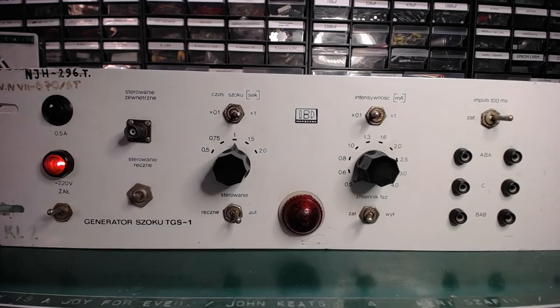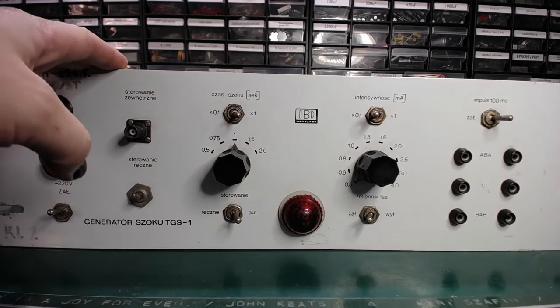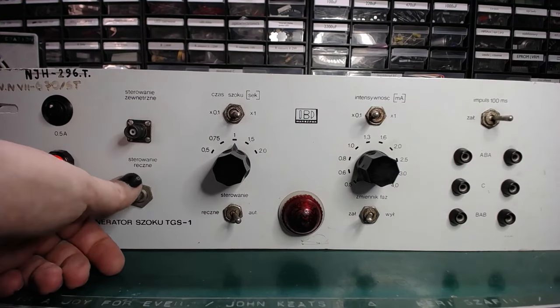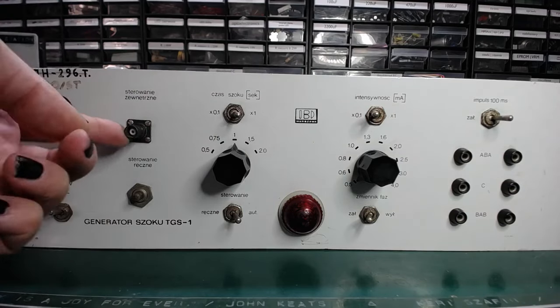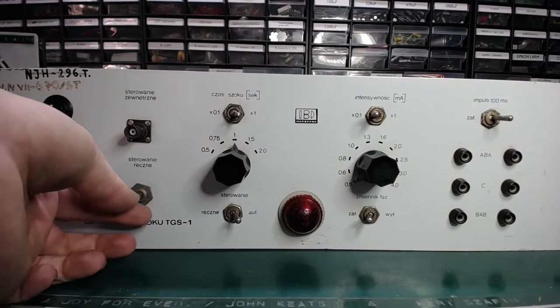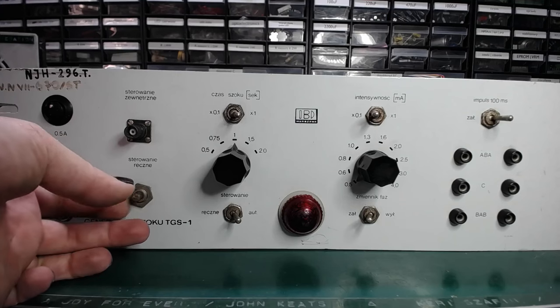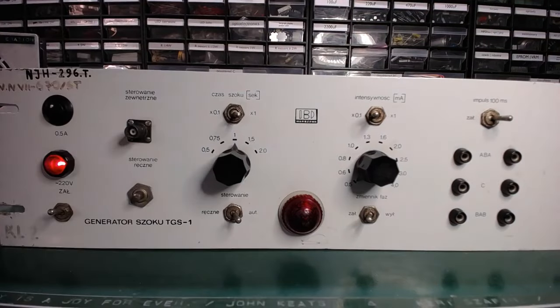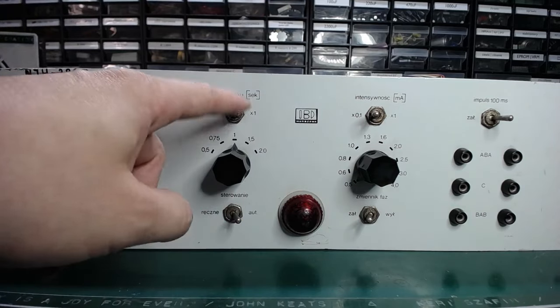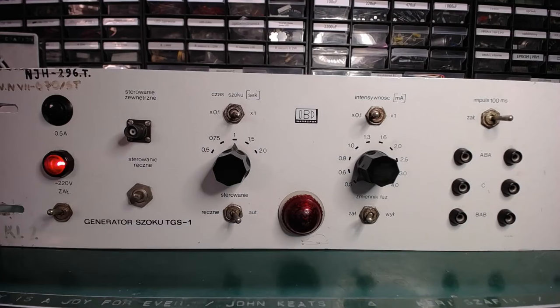Let's turn it on. I will shock no one. I will shock no one with this device now, as I demonstrated, but it has all kinds of different controls and a pretty nice front panel design. This is the main control, which is doubled with this BNC socket. When pressing the button, it will apply the short shock voltage for a preset duration. Those two controls determine how long the shock will be.